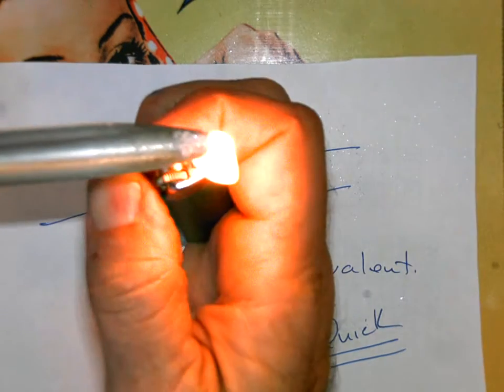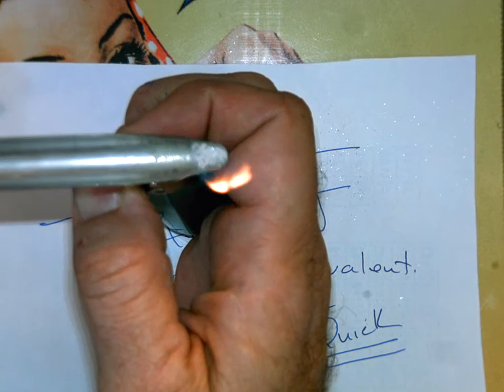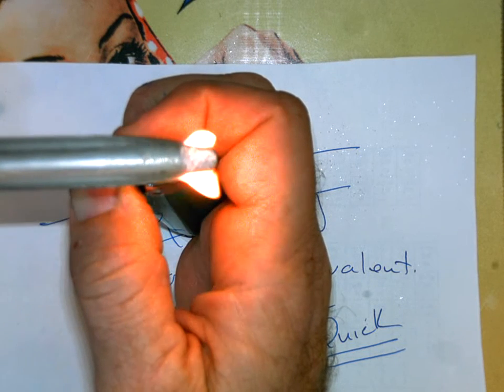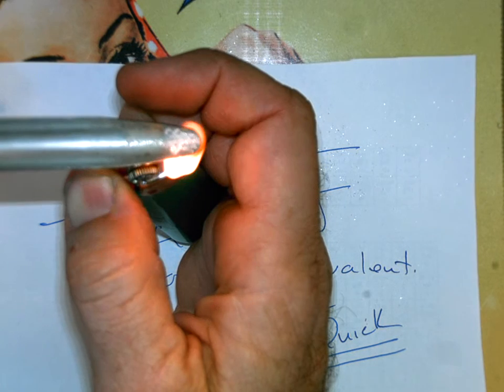Ionic compounds have a very high melting point. So now what's happening here? Hopefully you can see it. There we go. All right, the salt is going, 'Hey, what are you doing? You're adding some heat to me? I'm not gonna do anything.'